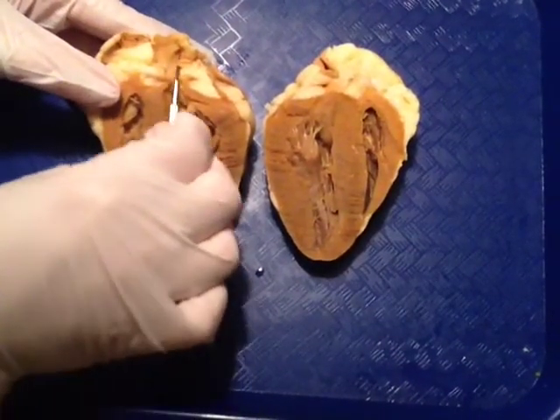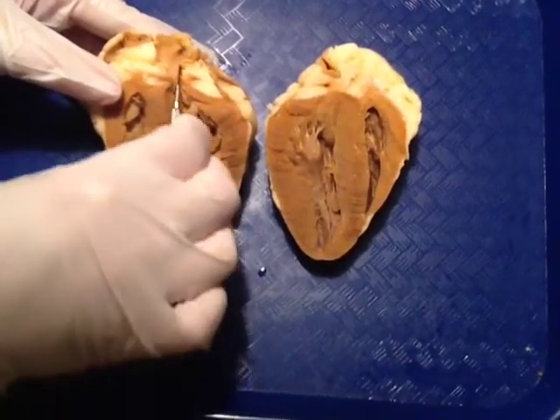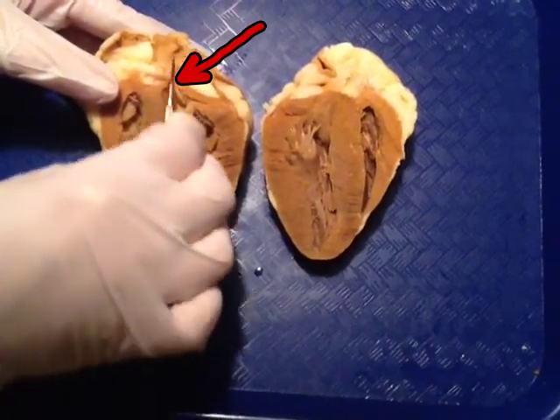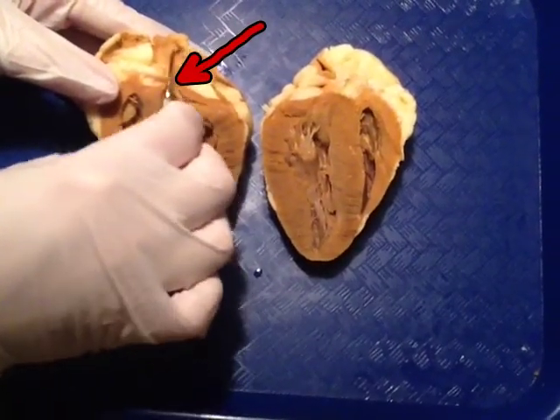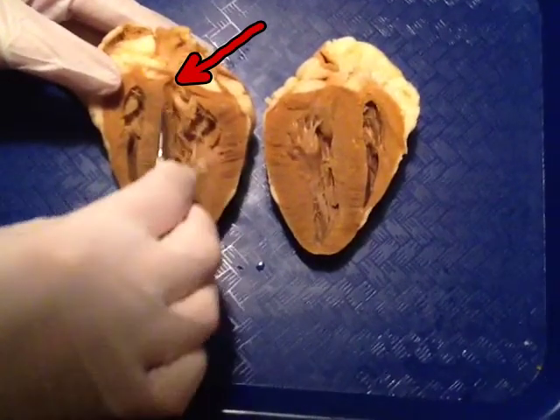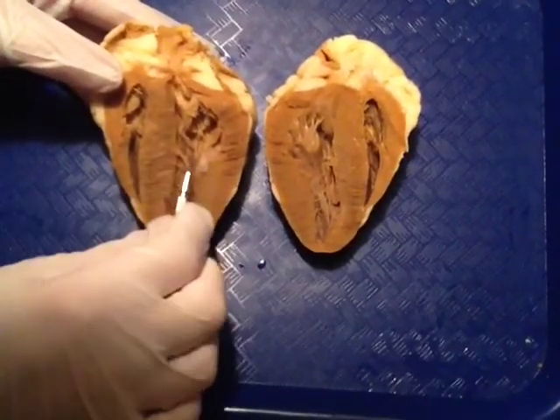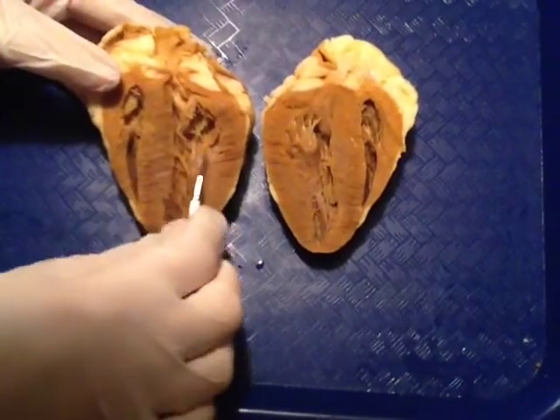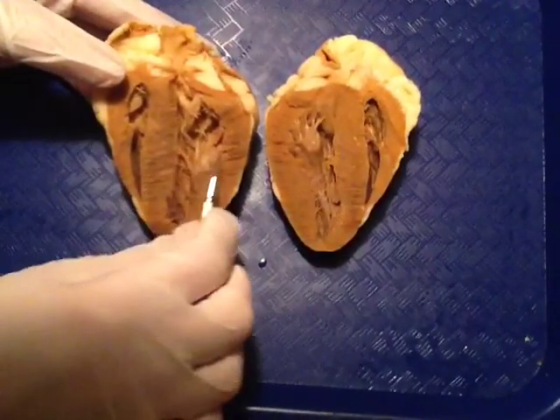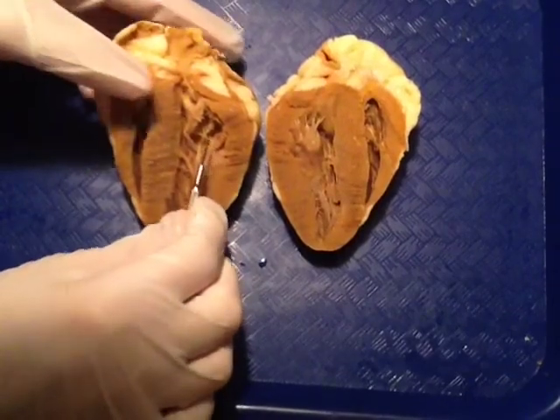Right here, you notice this is our first major blood vessel. This is called the aorta. The aorta leads into the left ventricle. We have the right ventricle, and over here we have the left atrium.